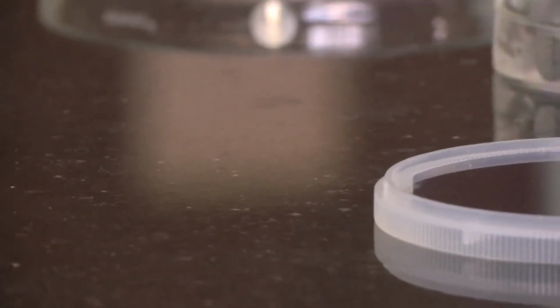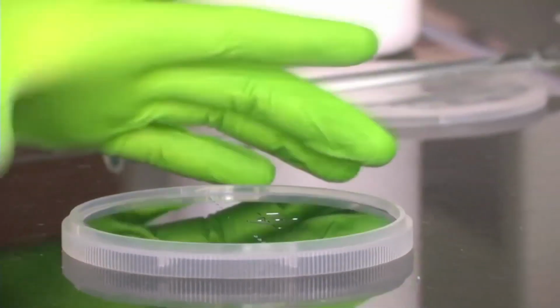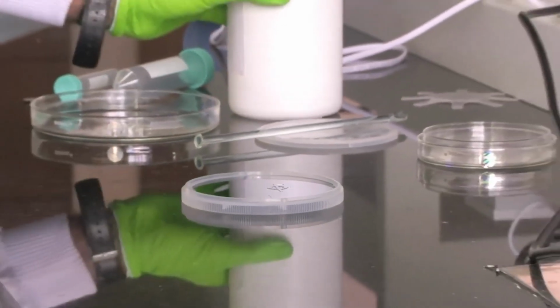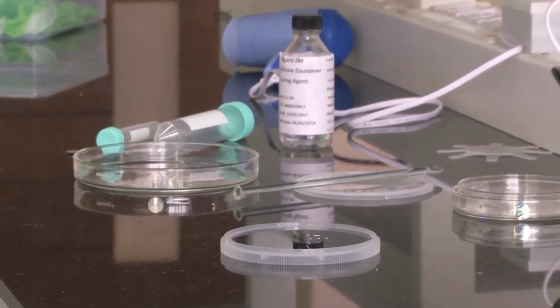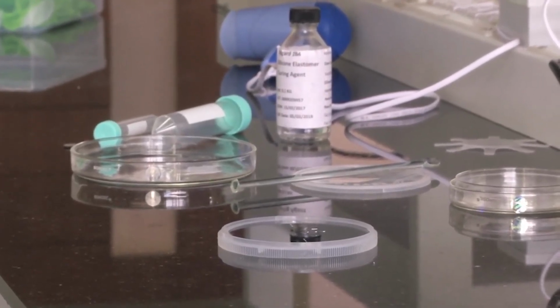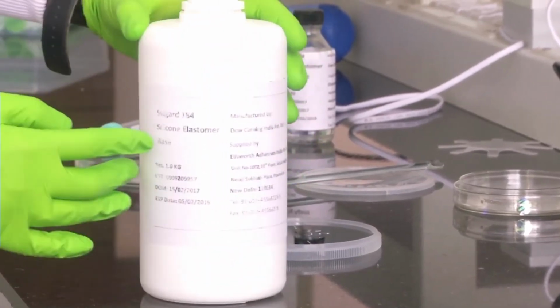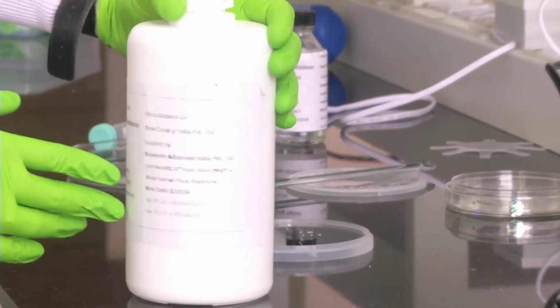Today we will be doing PDMS molding of this channel on the PDMS membrane. For this we have made this setup for the experiment. So what all things do we need? This is PDMS, a highly viscous liquid. It is generally called silicone elastomer. So it is basically PDMS.